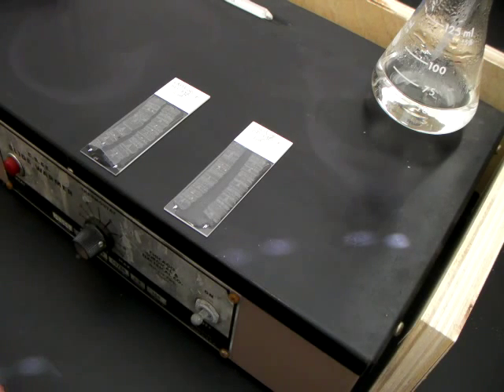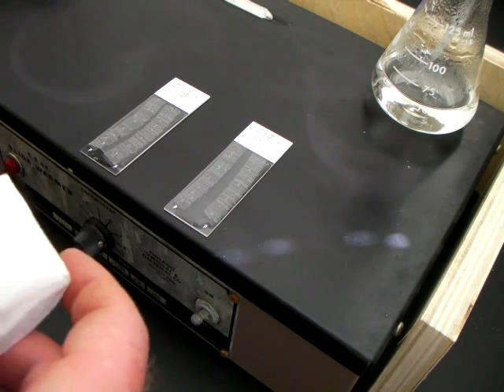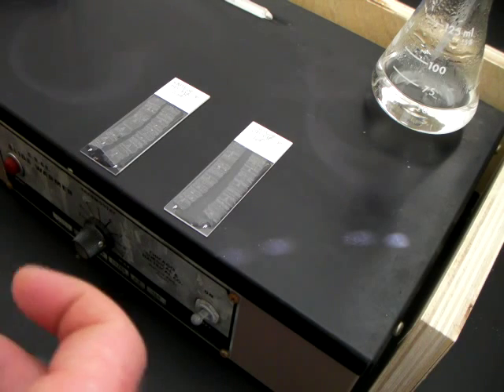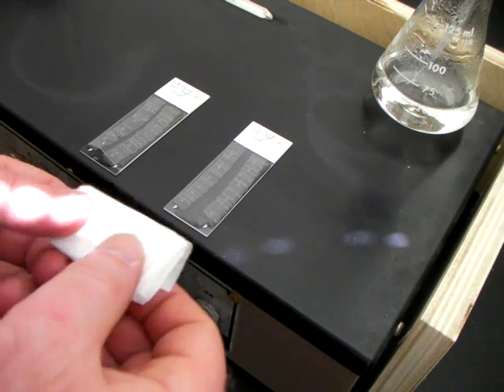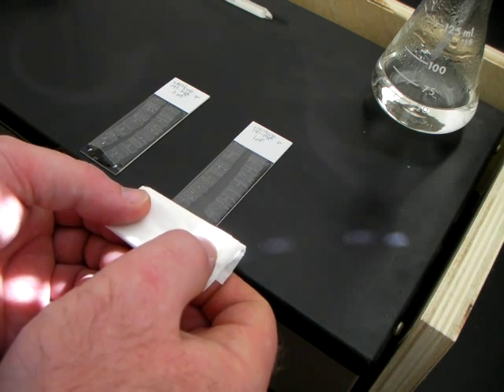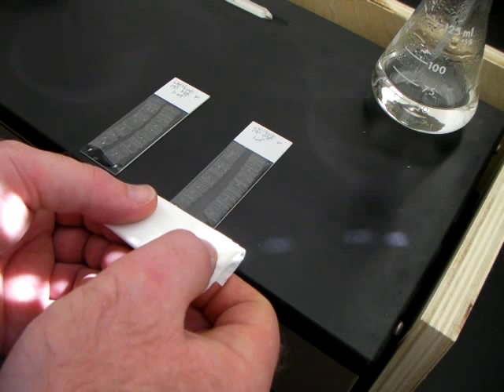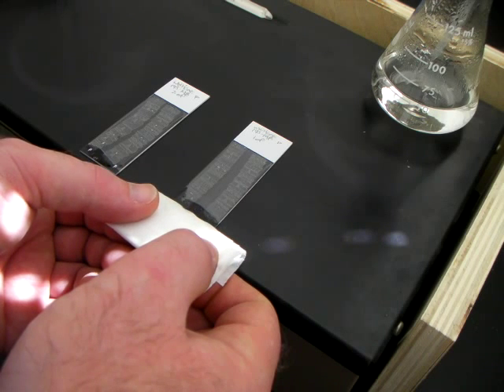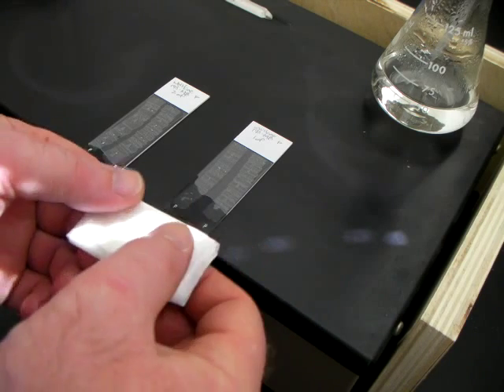It's very important that you do this in a very particular way. You don't want all the water moving the specimen around any more than you have to, so just fold up a chem wipe, touch it to the bottom, and let it wick a bunch of the water off of the slide.